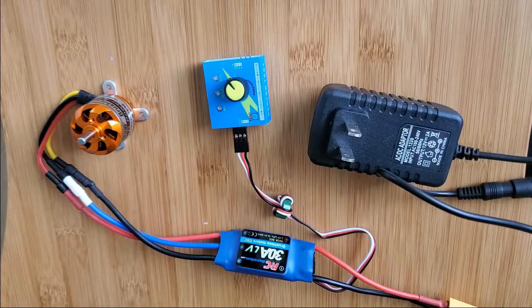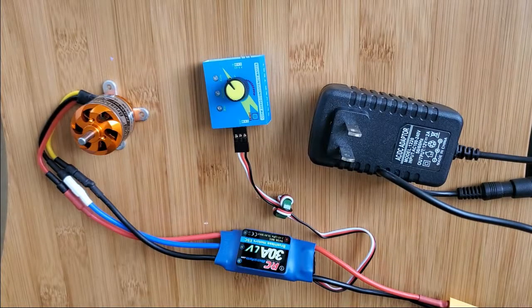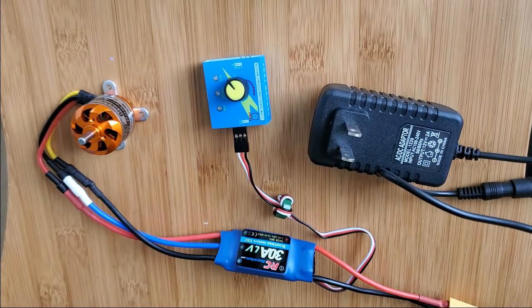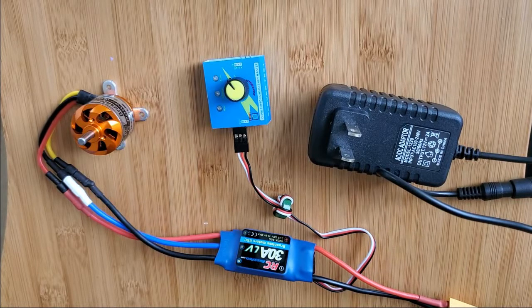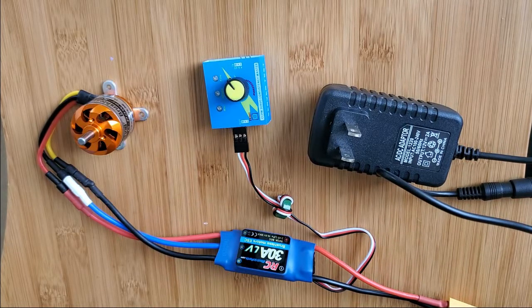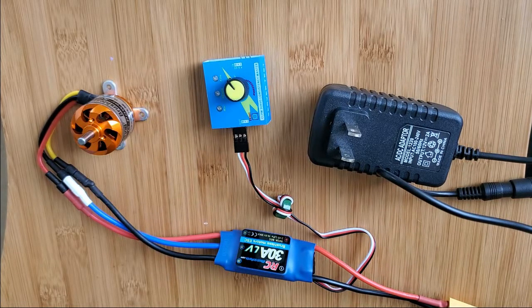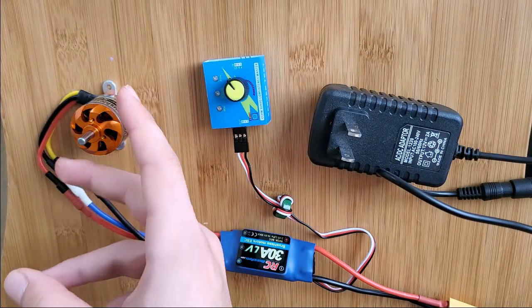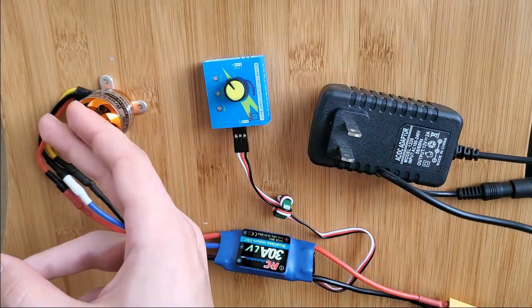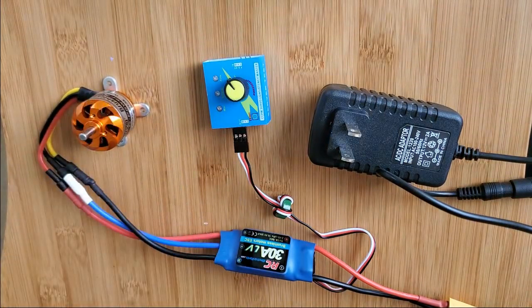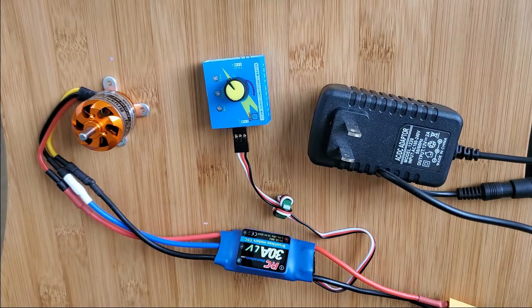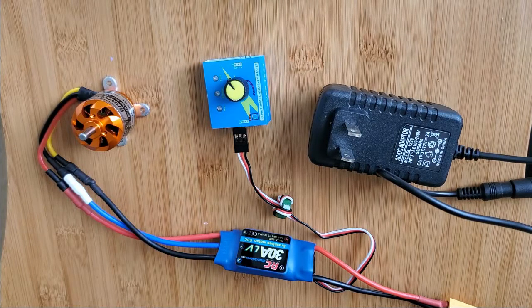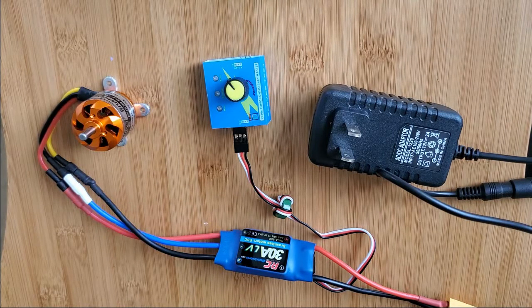Now that I have all the electronics assembled and seems to be working okay, the next step would be to actually build a rotor for the centrifuge so that you can load in tubes and actually test the centrifuge in a real situation.